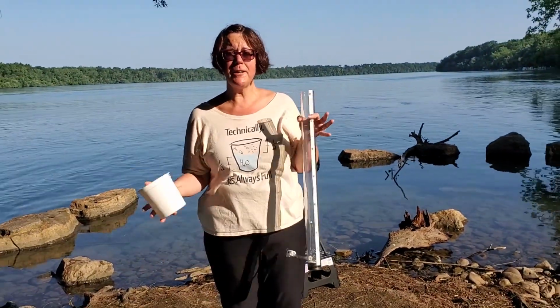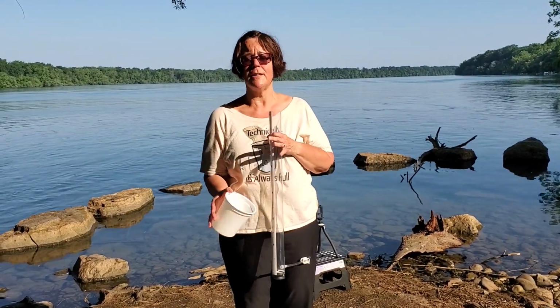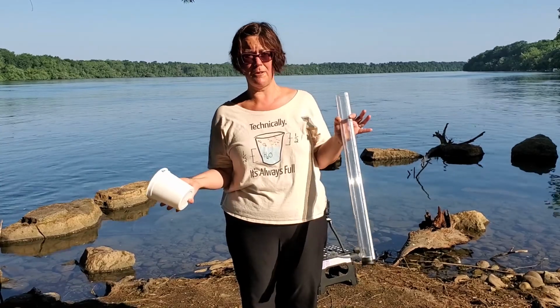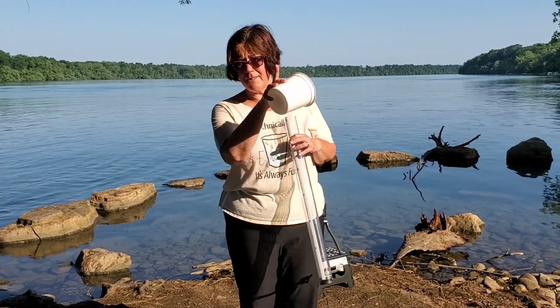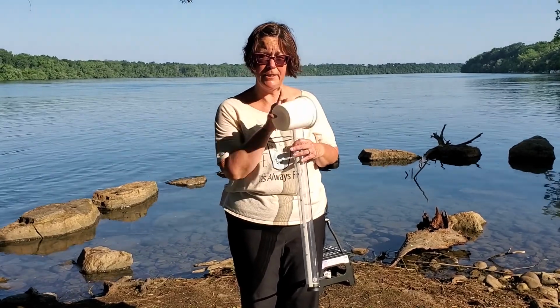A turbidity tube measures turbidity. Now you might ask, what is turbidity? It is another word for transparency in some ways. Turbidity measures the amount of sediment that is in water. The clearer the water, usually the better, because that means that the sunlight can filter through and the plants can do their thing, which of course is photosynthesis, providing food and oxygen for all of the organisms in the river. Sometimes clearness is not a good thing because it might mean that the water is too acidic. More on that later.